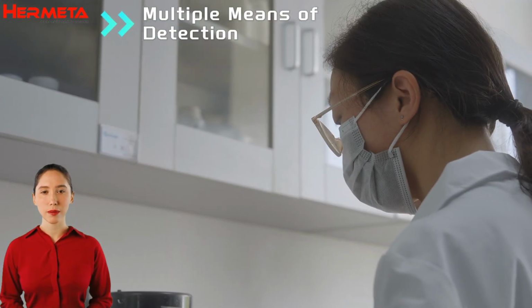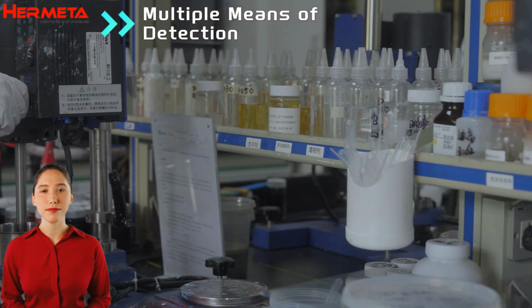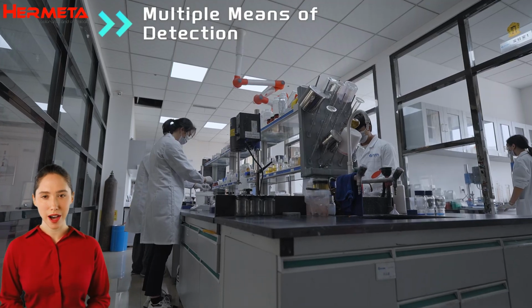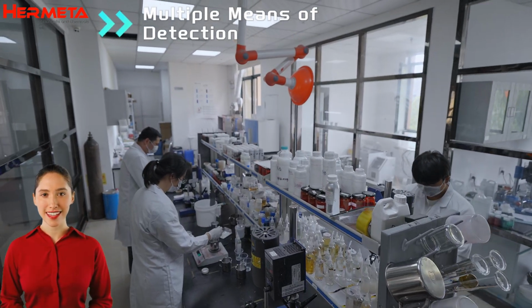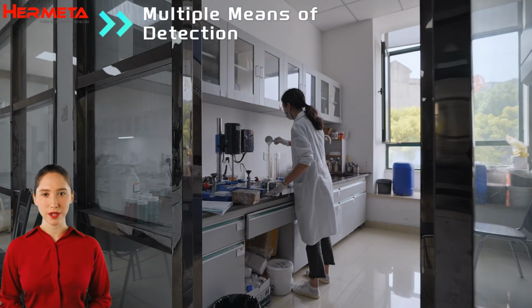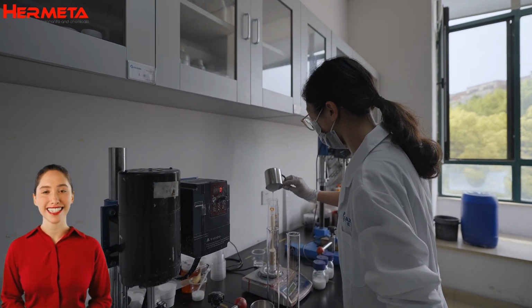Through professional equipment and strict testing standards, we ensure that every batch of organic pigment powder meets the high-quality requirements, providing customers with stable and reliable products. Our mission is to provide our customers with the most trusted and high-quality organic pigments through science and technology.